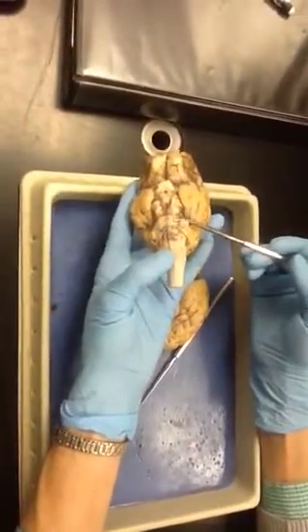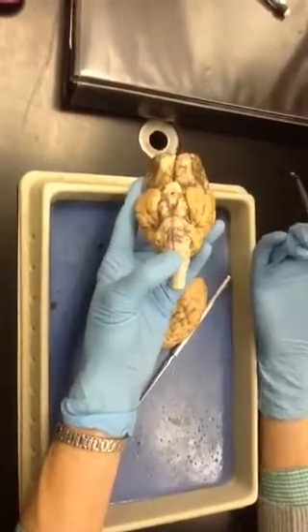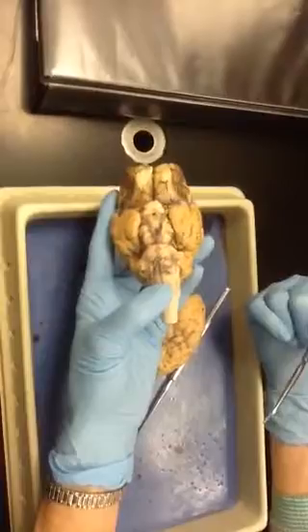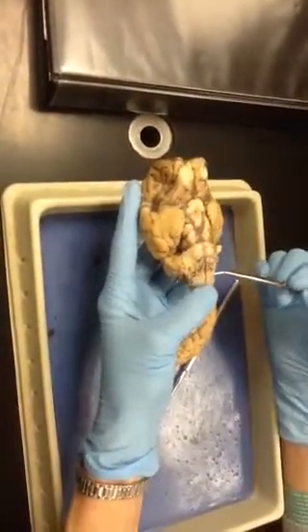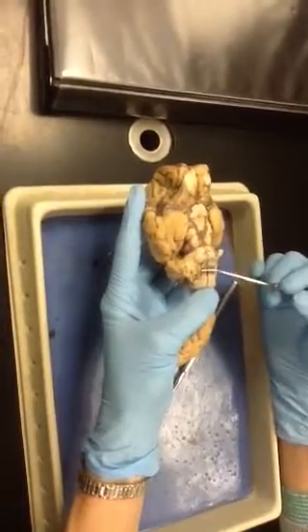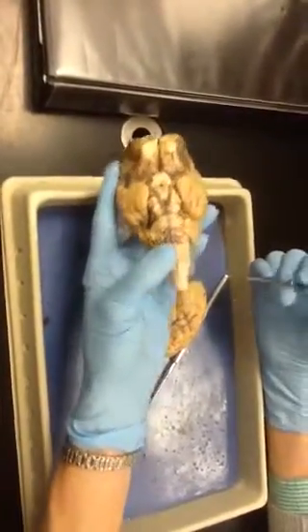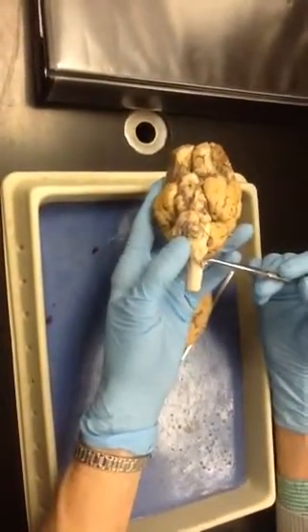This right here is what's left of a trigeminal nerve. The trigeminal nerves are the biggest, broadest of the nerves because there's actually 3 nerve trunks that come from that same region. So that's trigeminal. The one that you seem to be missing is the abducens nerve, which is a little nerve that comes right up here onto the pons, which seems to be missing in this particular one. And then these nerves down here are spinal accessory nerves down on the spine.